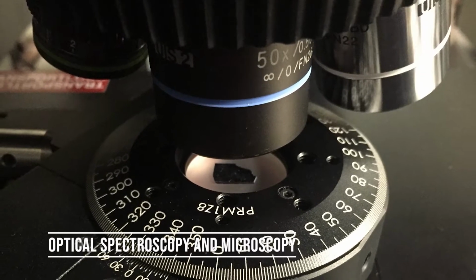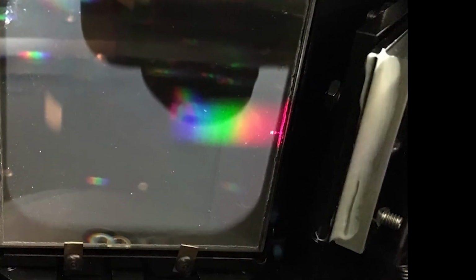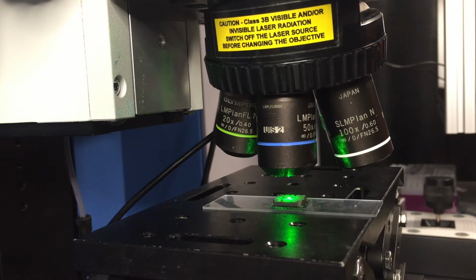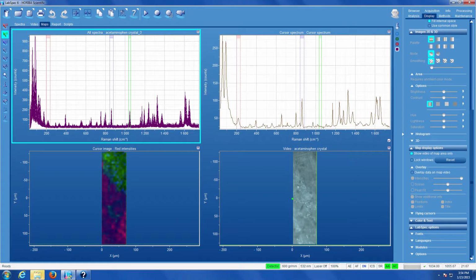The Optical Spectroscopy and Microscopy Lab accommodates experiments with ultraviolet, visible, and infrared photons in a variety of ways. The highly flexible Horiba spectroscopic microscopes allow for Raman scattering and photoluminescence measurements. They can accommodate a wide variety of samples and are often used to produce chemical maps.